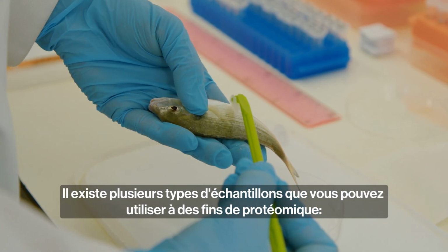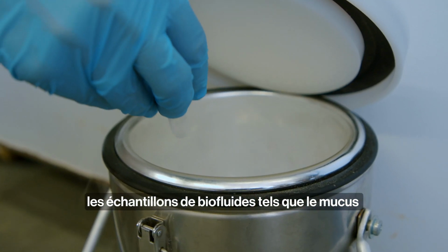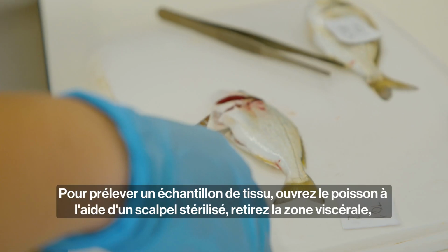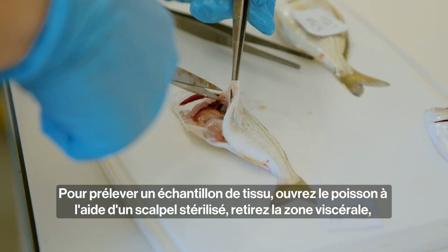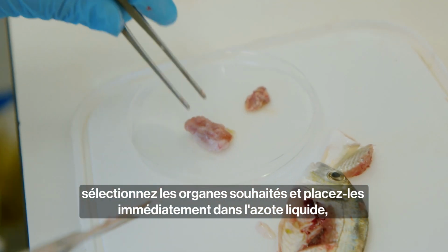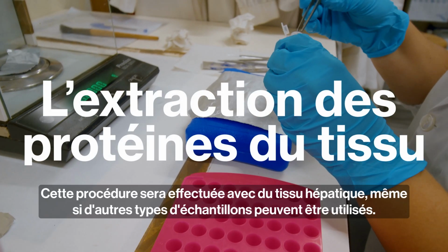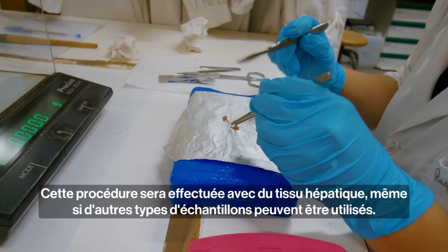There are several types of samples that you can use for proteomics purposes: biofluid samples such as mucus or plasma, which is obtained from blood centrifugation, and tissue samples. To collect this type of sample, open the fish with a sterilized scalpel, remove the visceral area, select the desirable organs and place them immediately in liquid nitrogen, properly identified. This procedure will be done with liver tissue, but other types of samples can be used.